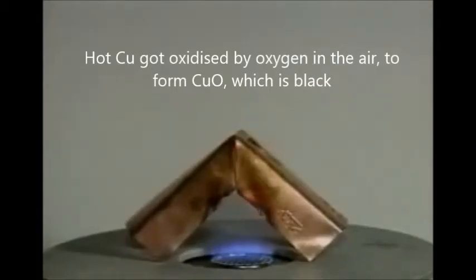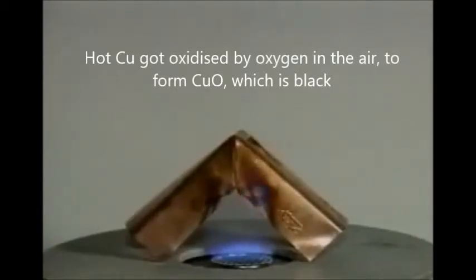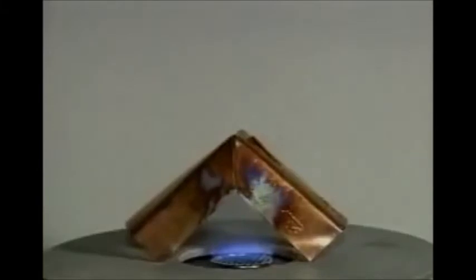A few seconds later, the copper has become dark. It has reacted with oxygen in the air.